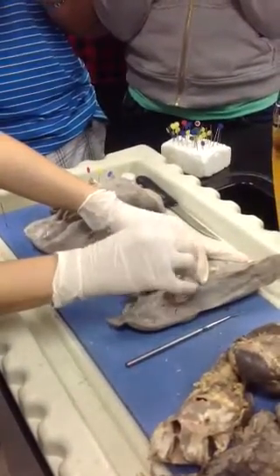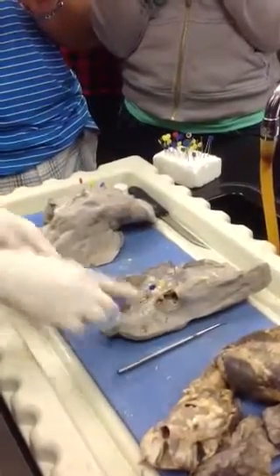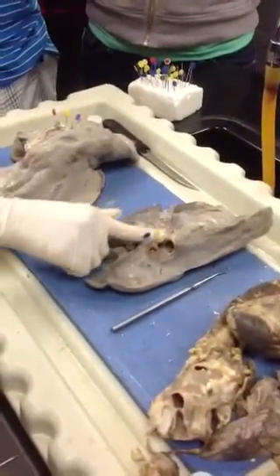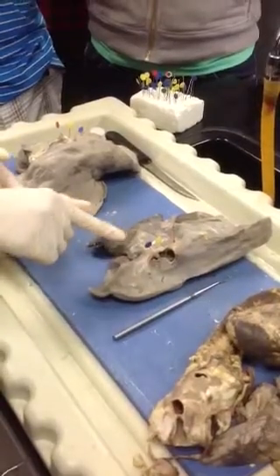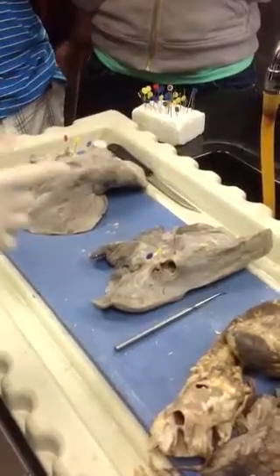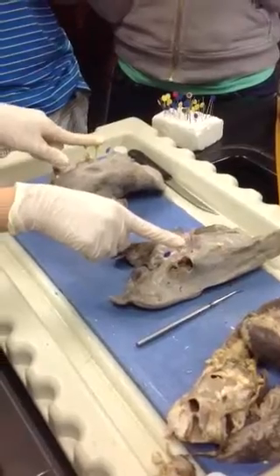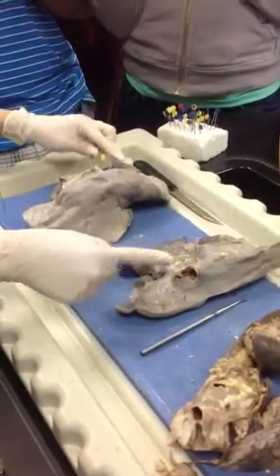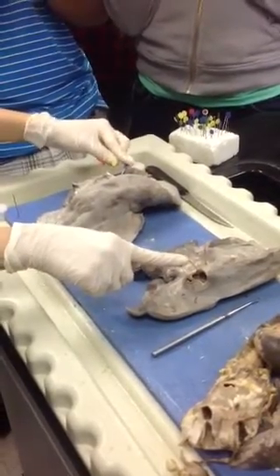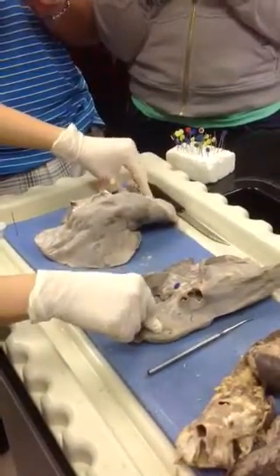So you can see at the blue, the tunica media looks like it can hold up on its own, but at the red, it looks really thin and it eventually collapses, right? So in order to keep things straight throughout, first identify the primary bronchus, which is at the yellow, right? Superior to the primary bronchus, we have what vessel? Pulmonary artery. Pulmonary artery. Okay, so that means that next to it, we have the superior lobe.